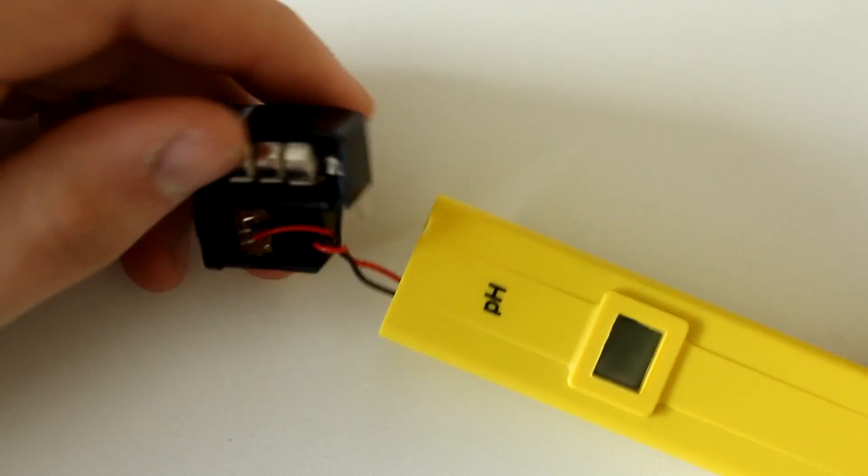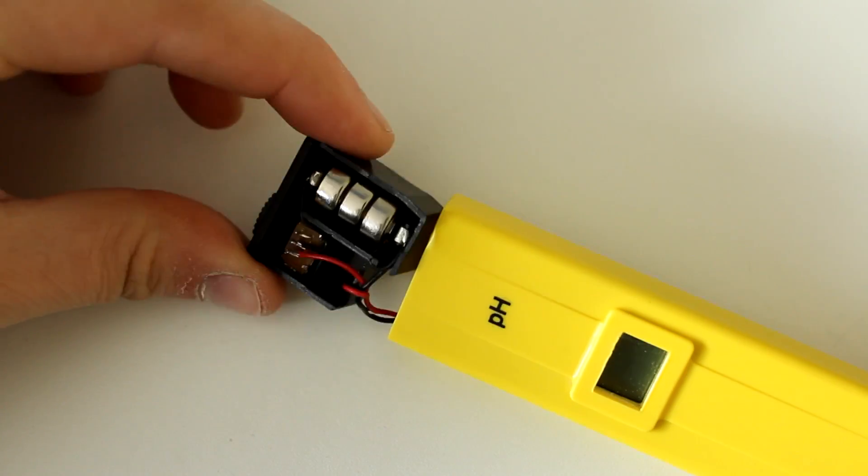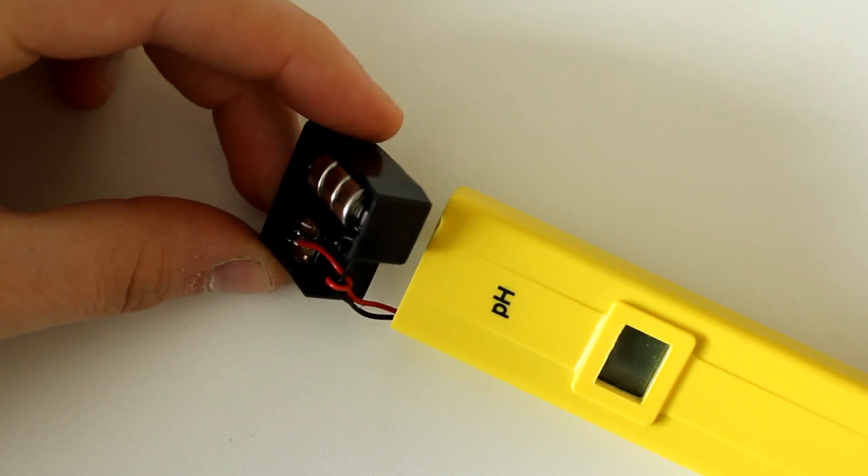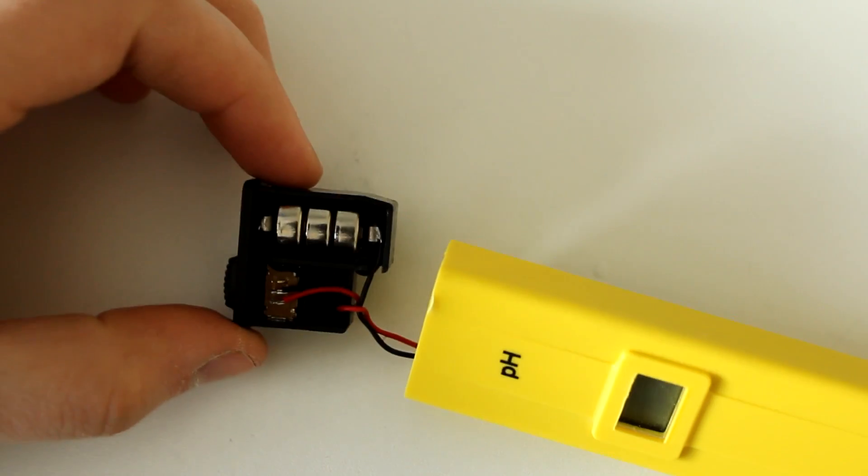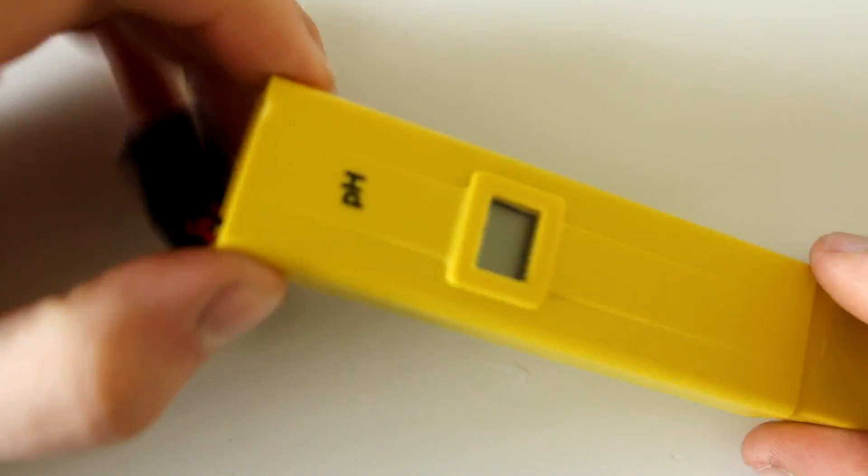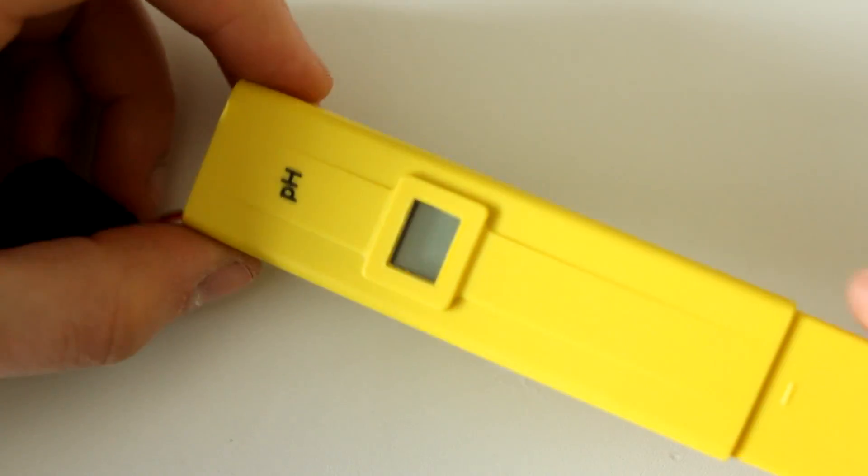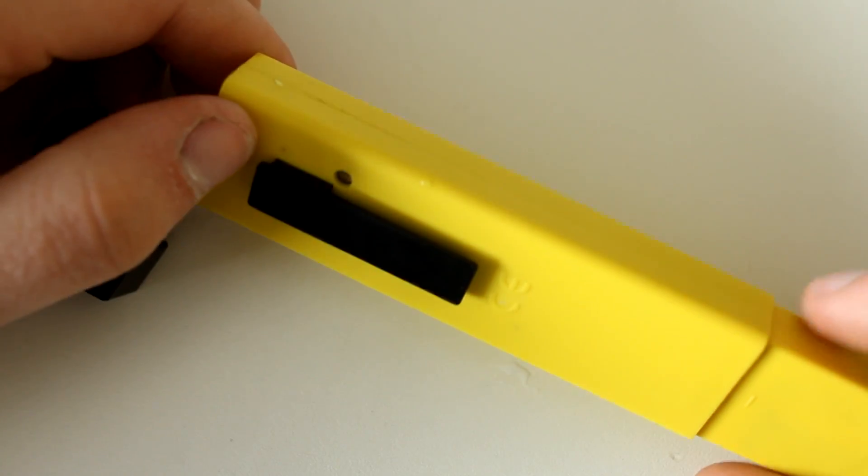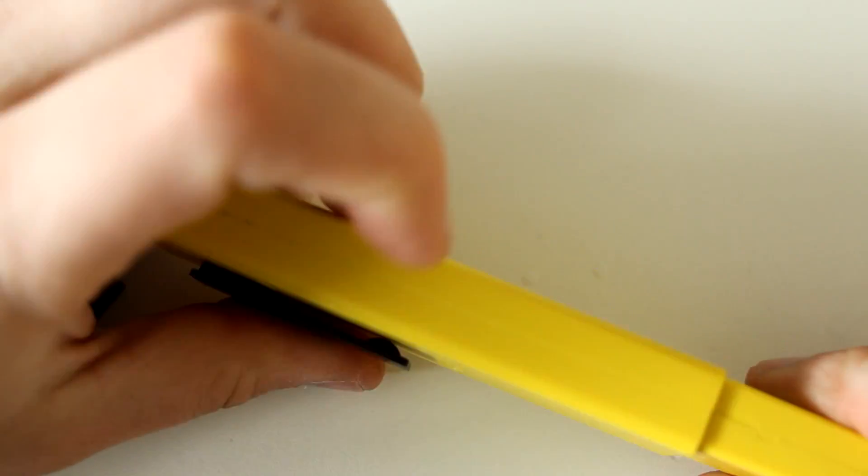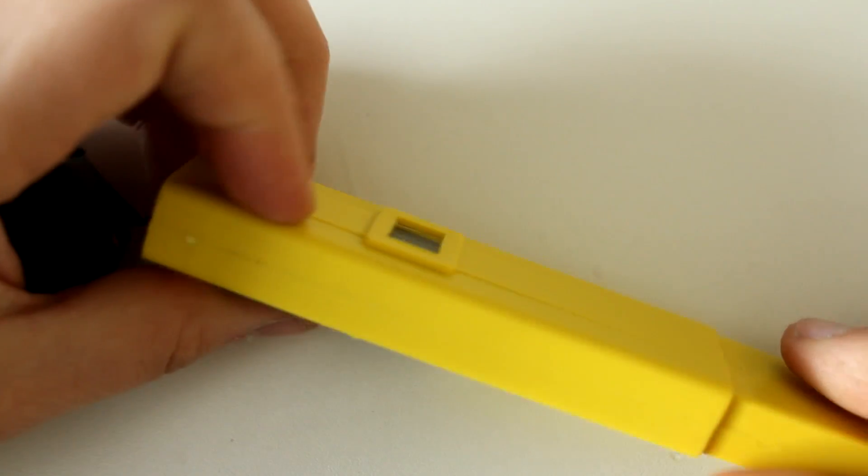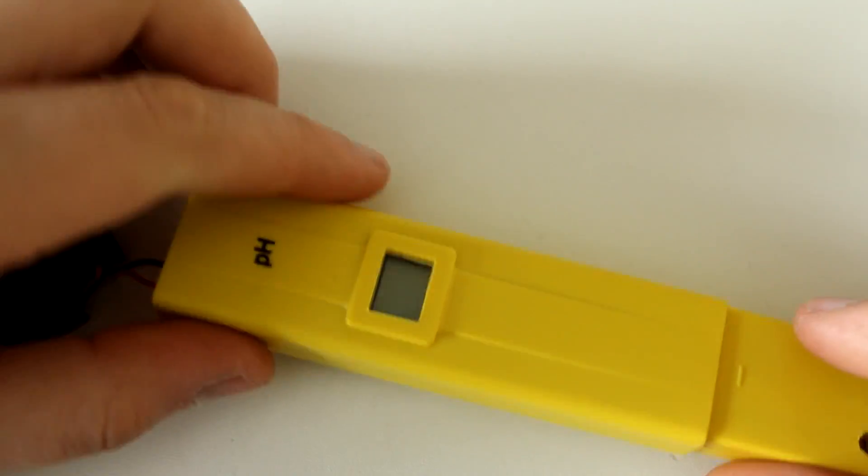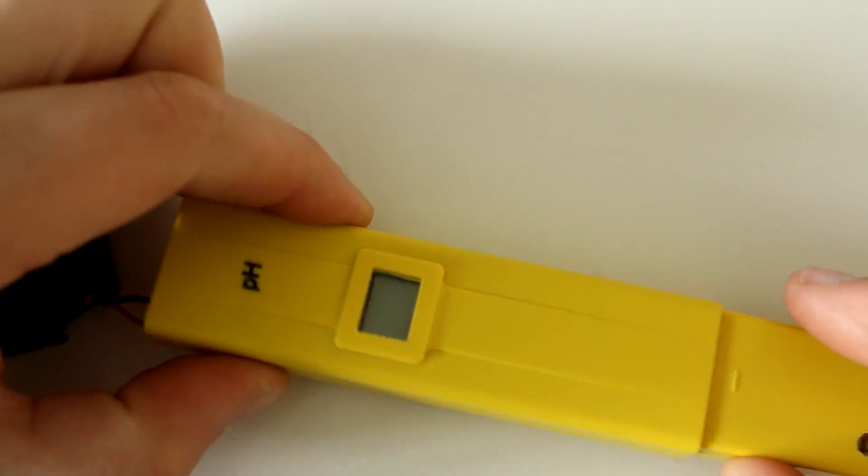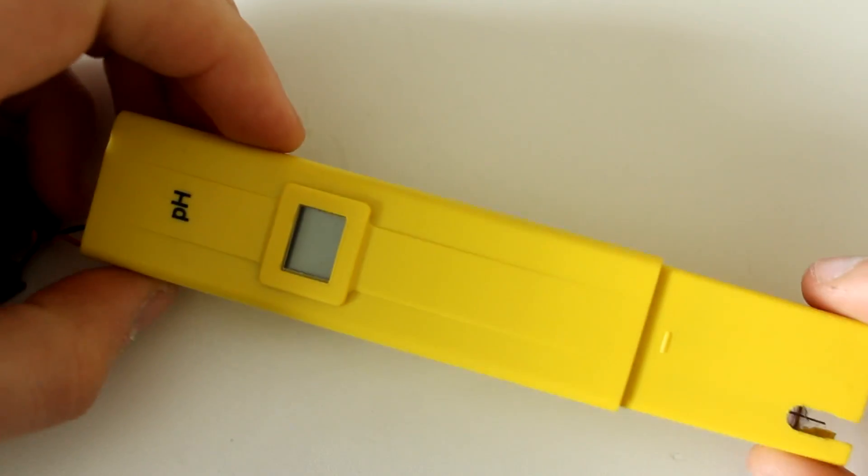There's this thing that actually comes out with the batteries which seems to be fine, and then the PCB itself is lodged in the casing. So I don't think this is repairable - I don't think you can easily slide it out. I'll have to break open the casing, and now that it's basically permanently broken, I can do that.